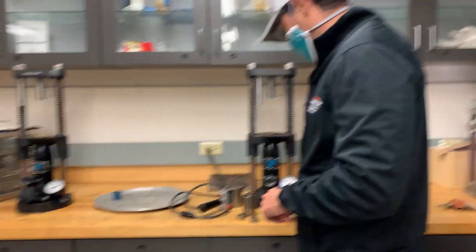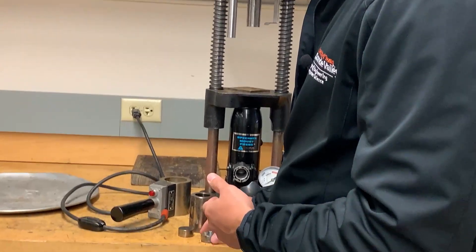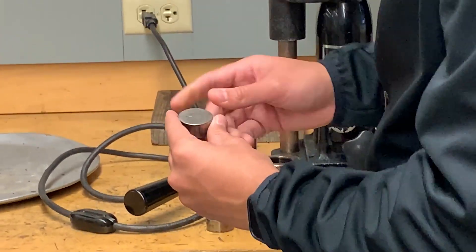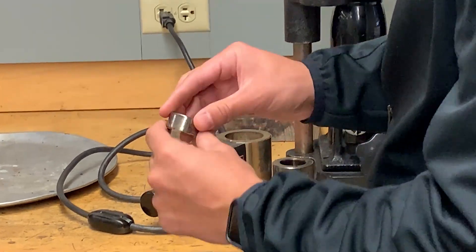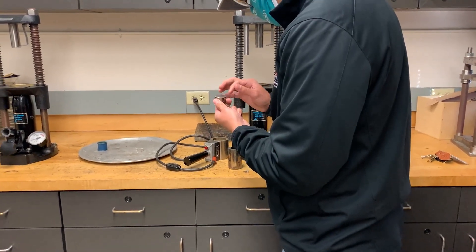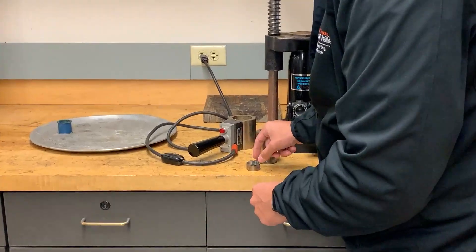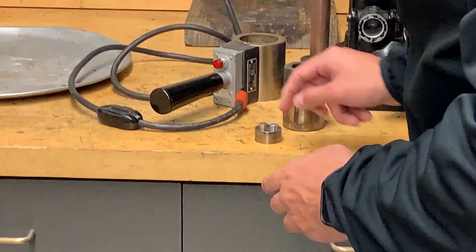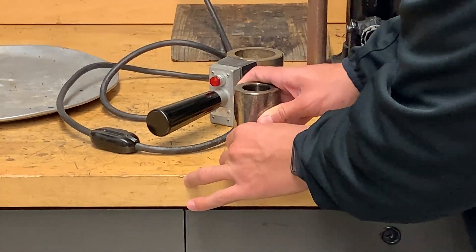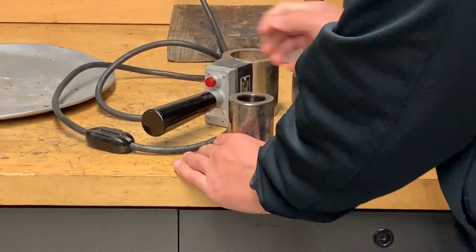We have our samples already cut. They're about even height — close enough. We want to place them on the mounting platform. We're going to choose one that is as flat as possible — I know a lot of these platforms are beaten up, but choose the flattest one we can find with minimal deformation. We're going to spread the samples apart just a tiny bit and place the mold cylinder over the platform. If your samples move, you can just readjust them.